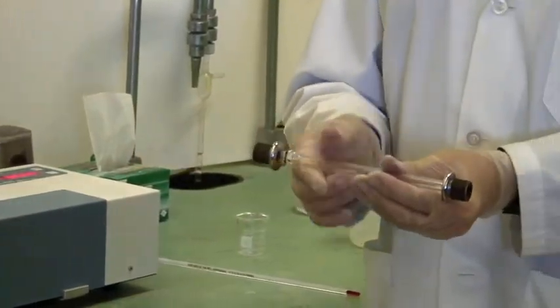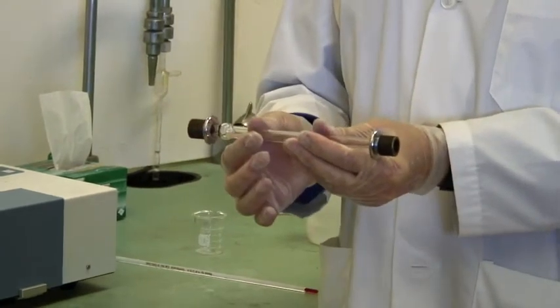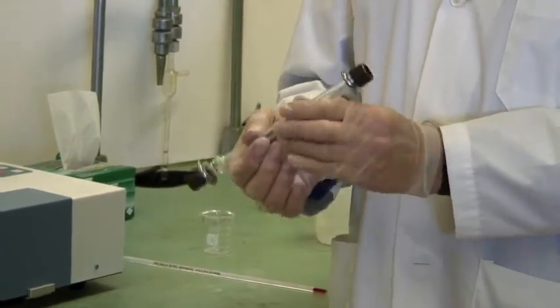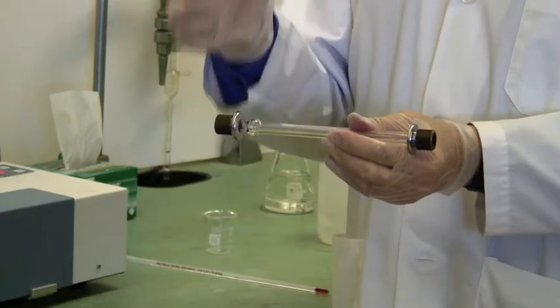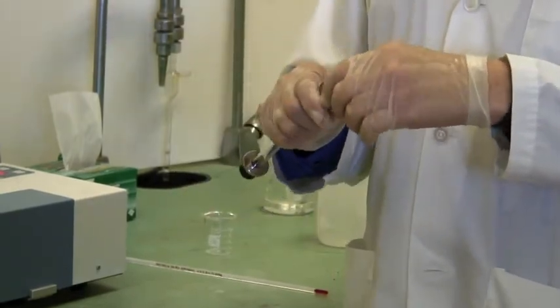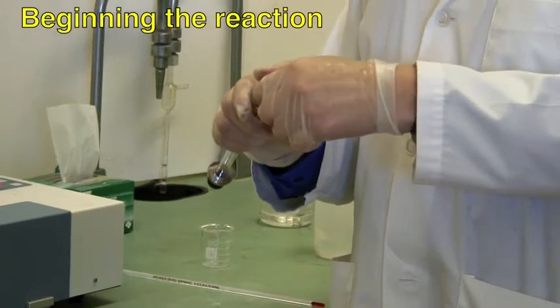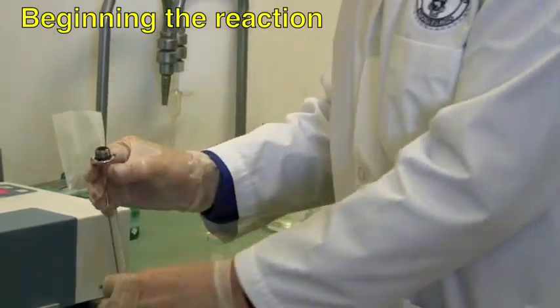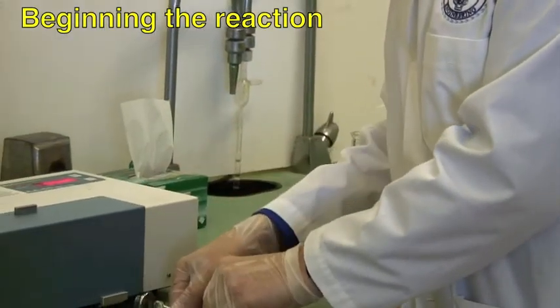This tube is actually exactly two decimeters long and it has flat glass plates at either end. Open one of the ends and that's where we're going to fill it in a minute.